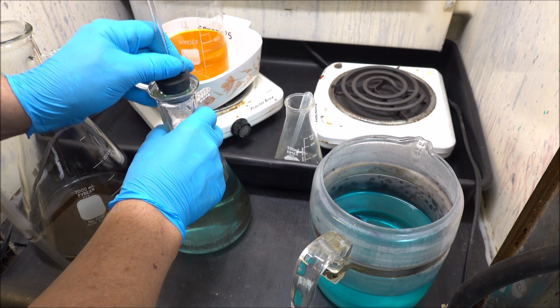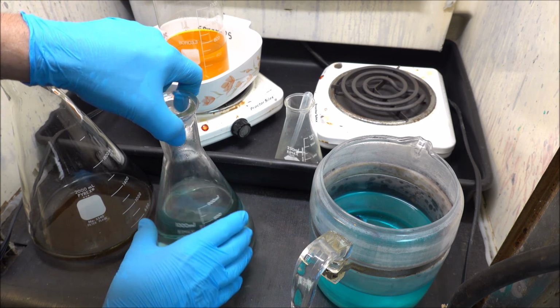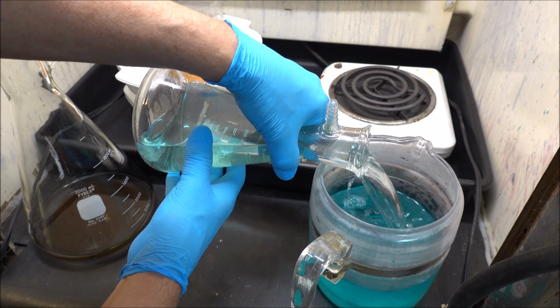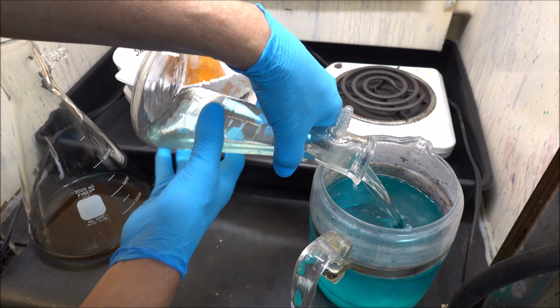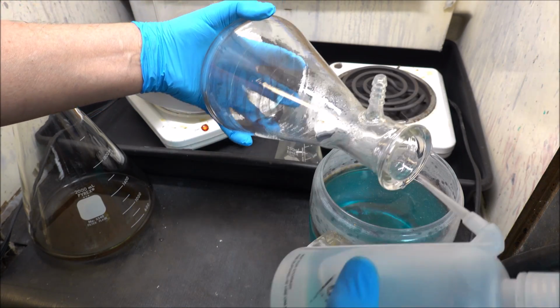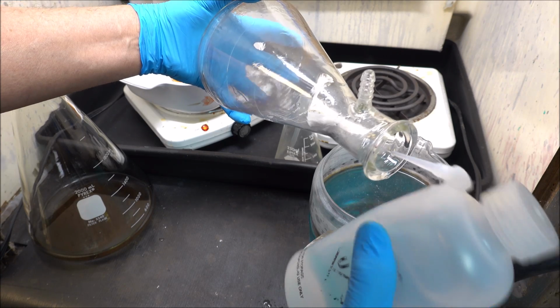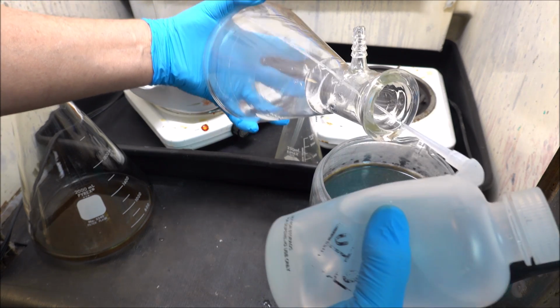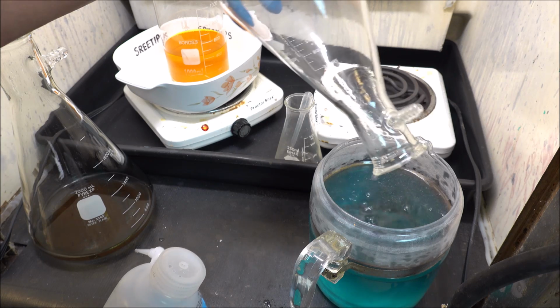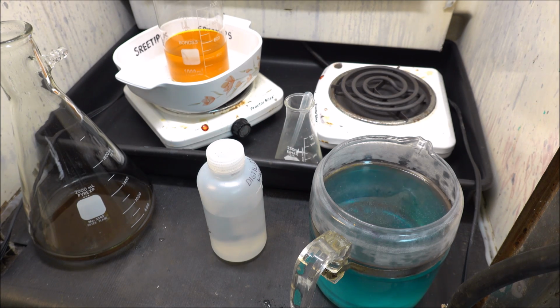If I tried adding these solutions to my stock pot, it would end up forming silver chloride in my stock pot, and that's an undesirable thing. So I'm going to add all this into my silver jar here, and then this will be cemented out with copper. Any gold that I rinse in here will get filtered out when I process the silver. When I process the solution for silver content, the first step is to filter it out. So any gold that gets added in here will be recovered during that filtering process.